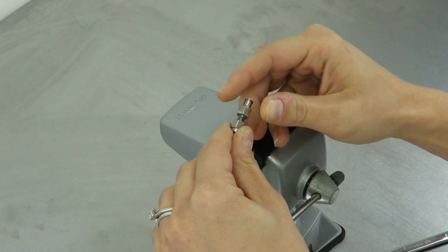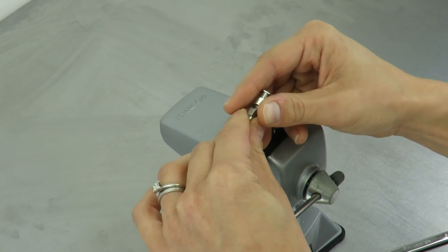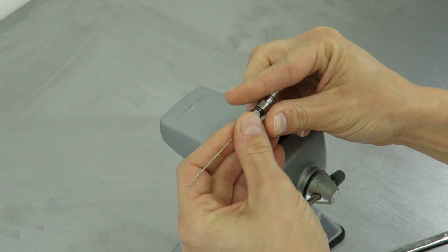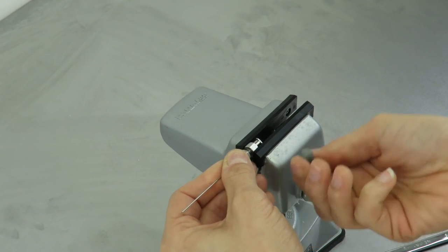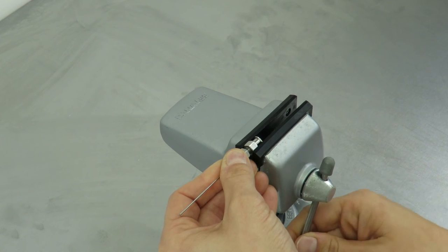Then, hand tighten the nut. At this point, you can make slight adjustments to the length of the tubing if you need to. In most cases, this is less than an eighth of an inch, but it does give you some flexibility in testing with needle length.